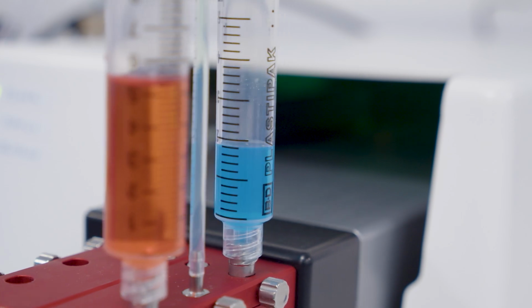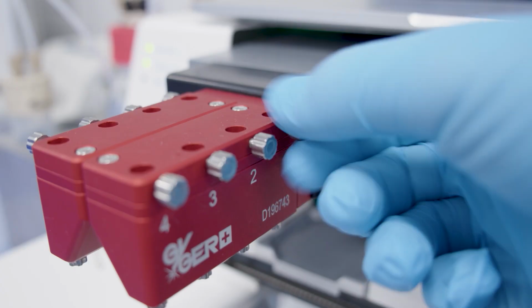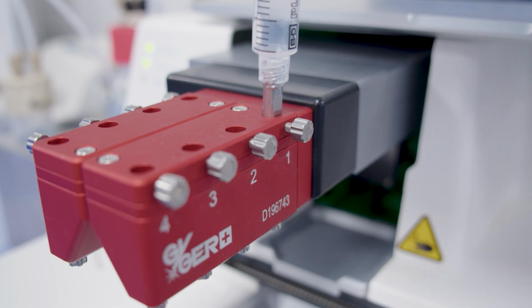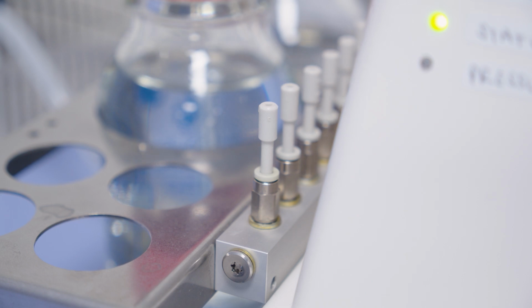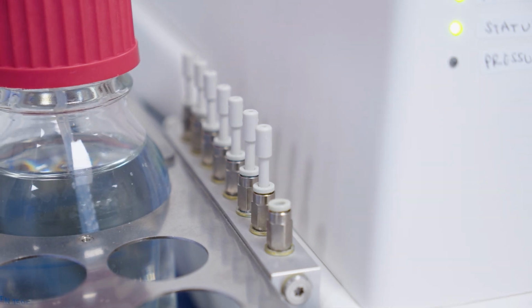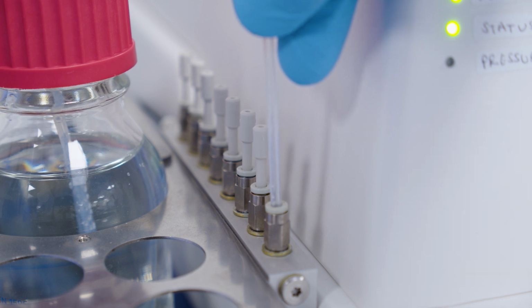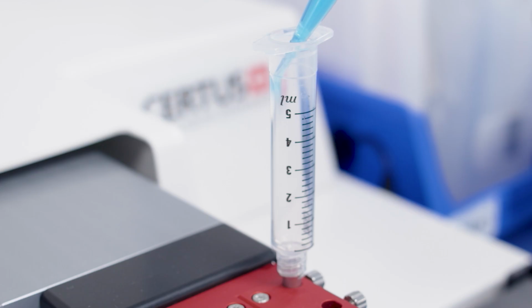Now it's time to load the liquids. We'll start with a syringe. Take an empty syringe and ensure it's got a metal inlet adapter and adapter head. Unscrew the bolt of the channel you're using and place the syringe in until you hear a click, and fasten the bolt again. Then remove one of the stoppers from the compressed air supply by pushing down and pulling up. Now you can place the syringe's air supply tubing firmly into one of the compressed air supply valves. Finally, you can unscrew the adapter head and load your liquid.